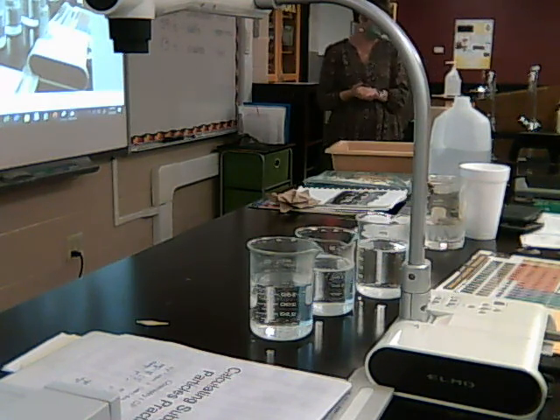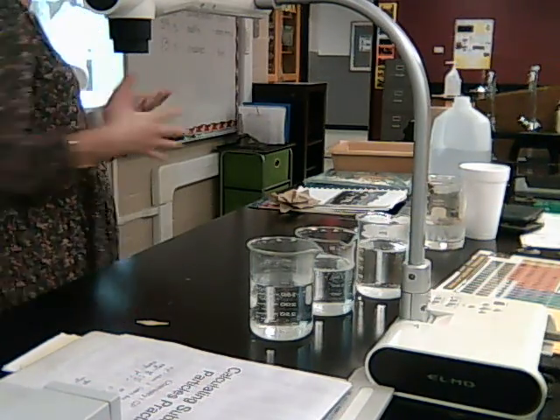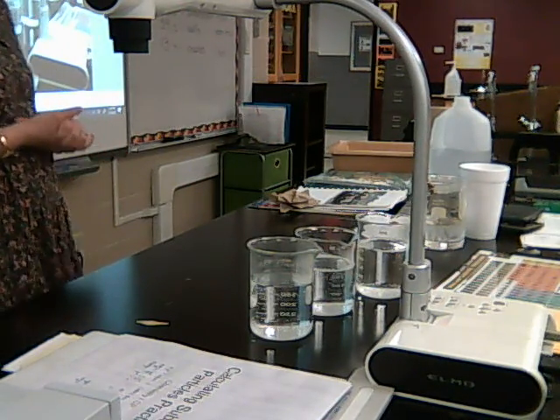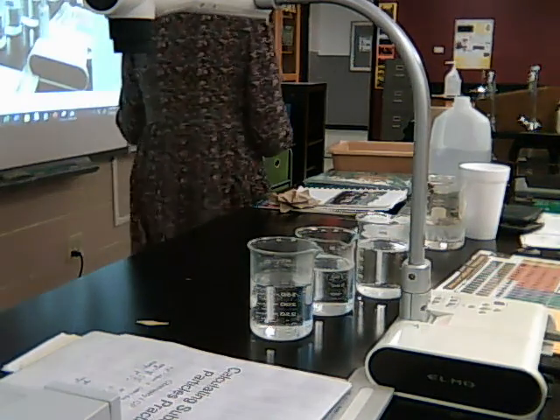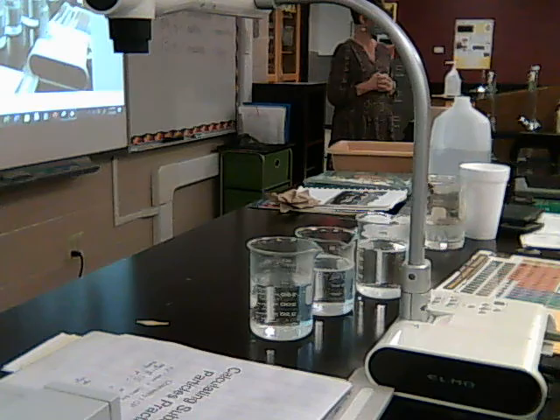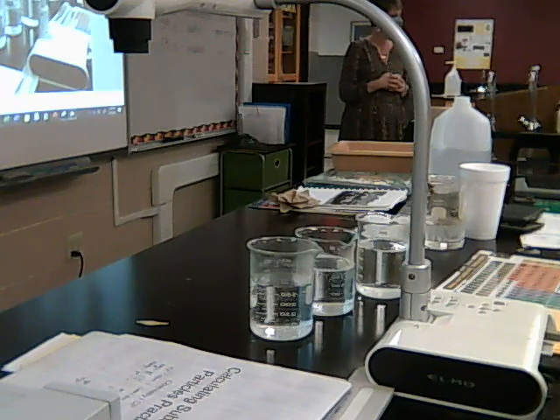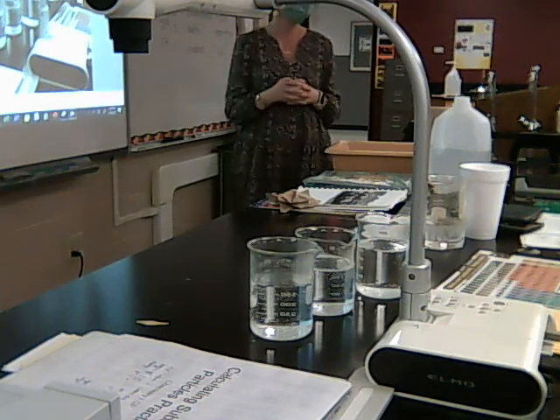It doesn't tell us anything, does it? Okay? Because I just made a big boo-boo, didn't I? That's one huge mistake that I made. What is the big mistake that I made right here? Why does this data not tell me anything about how the surface area affects the rate of the reaction? Okay. Was there a control group? I said that wrong. I know what I mean to say, but I don't know how to say it. What is wrong here with this data?